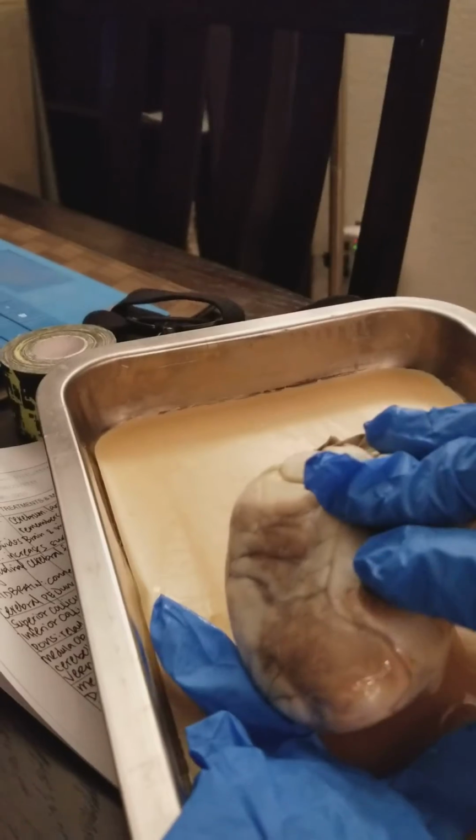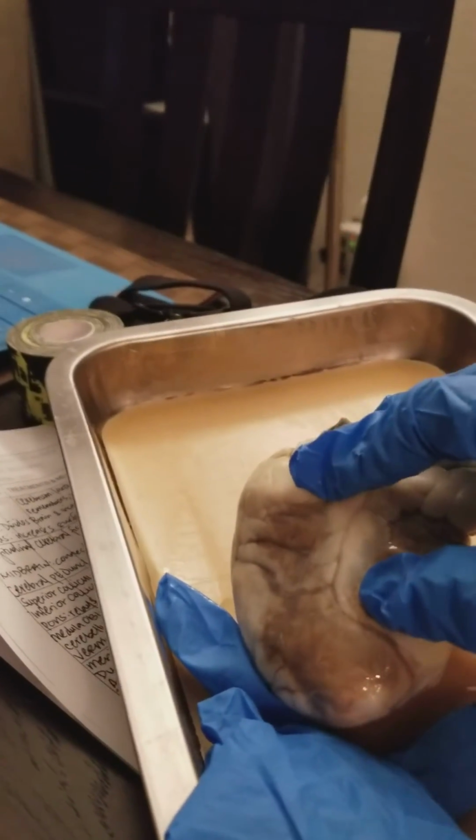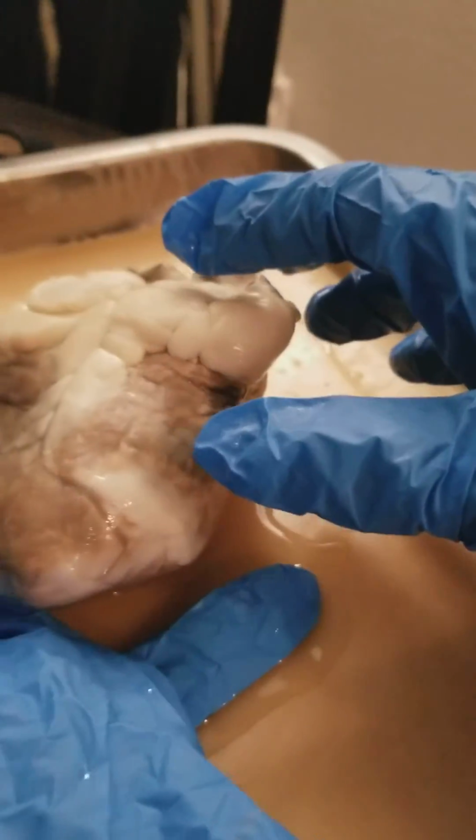So I'm going to stop the video so I can cut open the heart and continue with my presentation.